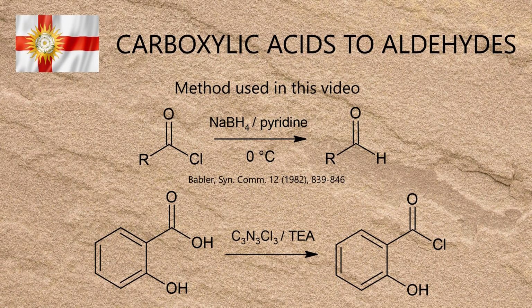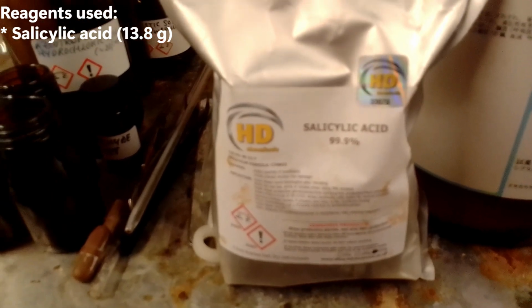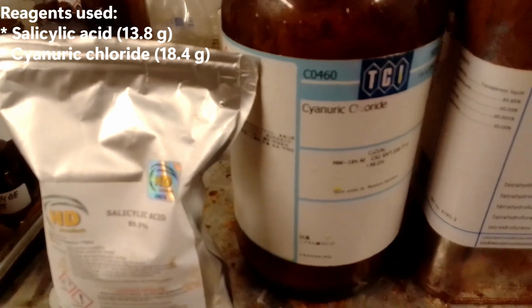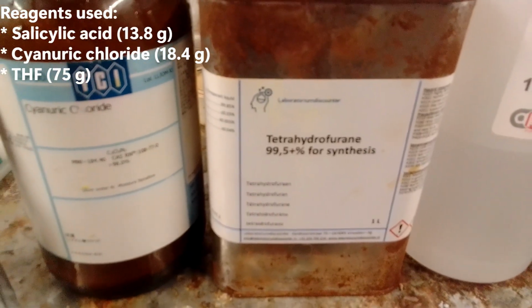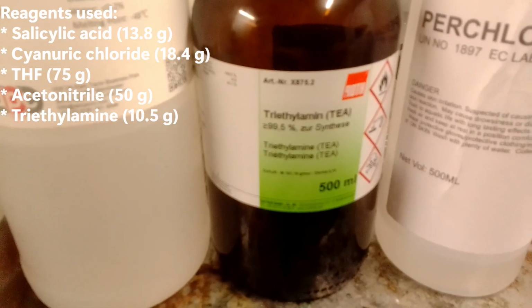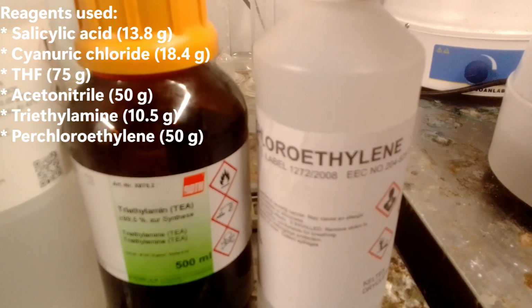The first step is to convert salicylic acid to salicyloyl chloride. I've gone over the method of turning acids into acid chlorides in detail in my last video, so other than detailing the improvements I've made since then, I'll keep this short and sweet. The reagents used were salicylic acid, 13.8 grams, cyanuric chloride, 18.4 grams, THF, 75 grams, acetonitrile, 50 grams, triethylamine, 10.5 grams, and perchloroethylene, 50 grams.